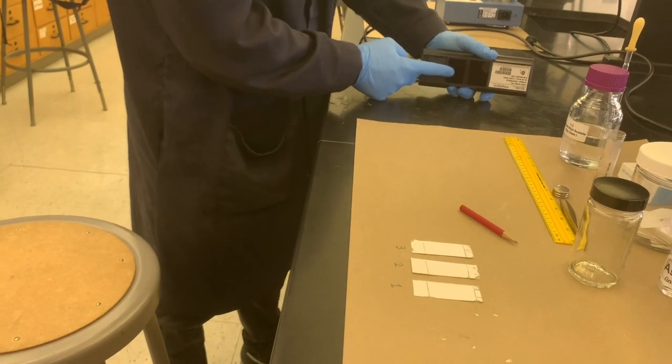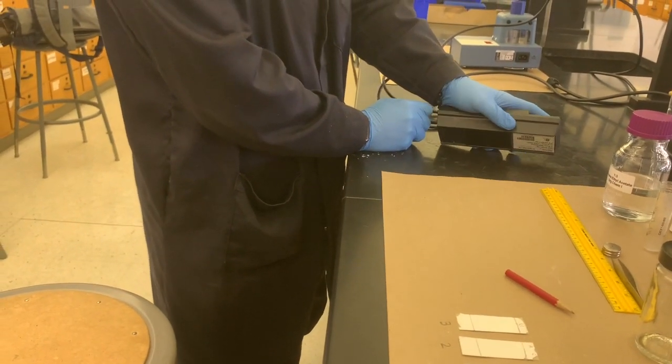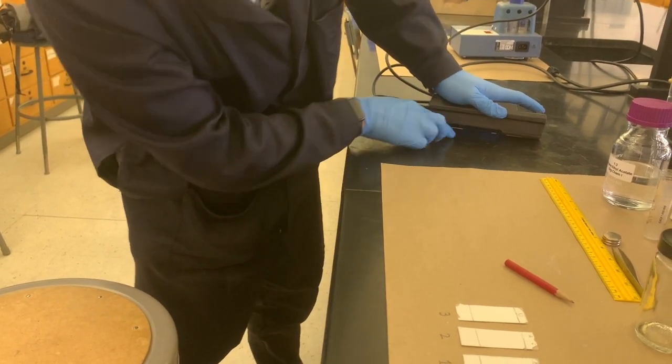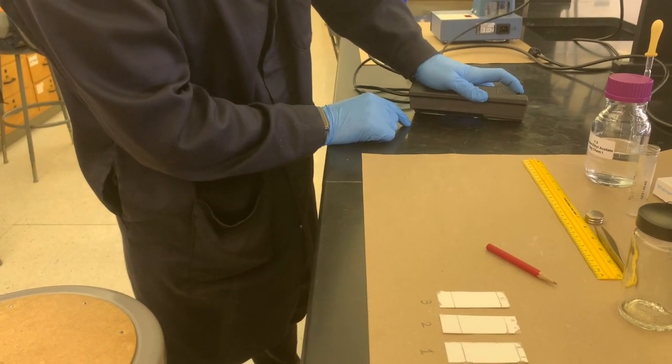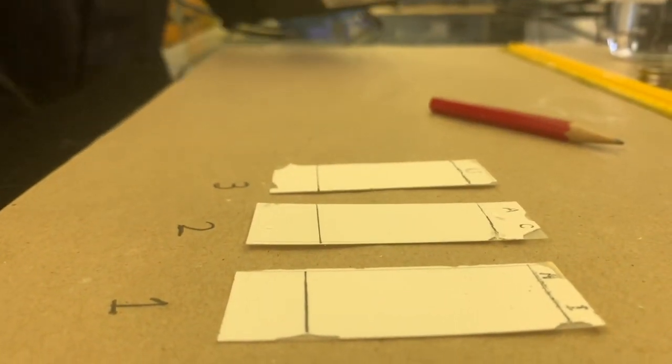So here's where the UV comes from before we turn it on. And you can actually see the UV on the surface of a countertop if you turn it on as it reflects back. But you should also not look directly at the light because it's not good for you.